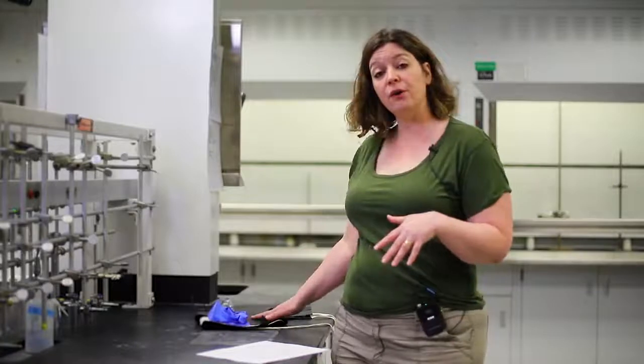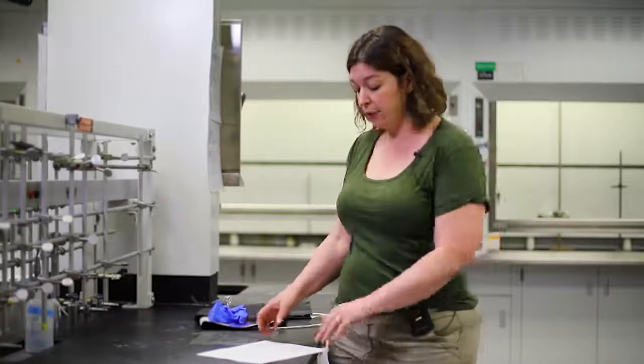And finally, there's something called injection. Now, obviously, we're not going to have you pick up a syringe and inject something into you, but if you have cuts on your hand or breaks in your skin, if you have a rash or a scrape, that can provide access for hazardous materials to bypass your skin barrier and get directly into you. So again, you're going to want to wear safety gloves or an impervious apron, or make sure that you get this off of you right away if you do have breaks in your skin.